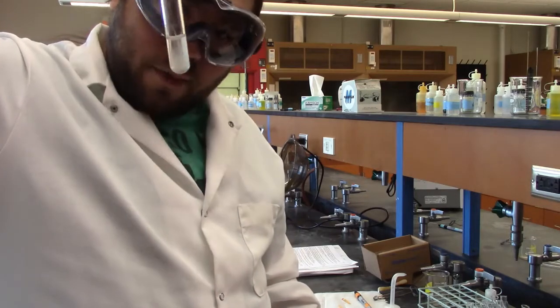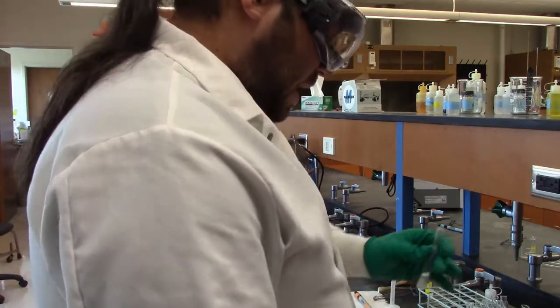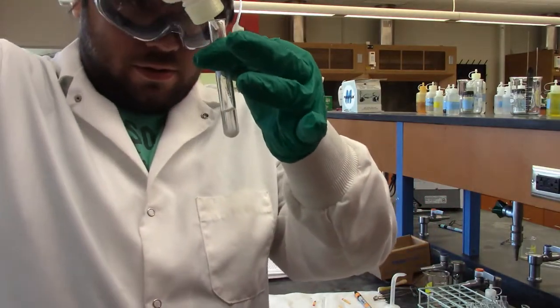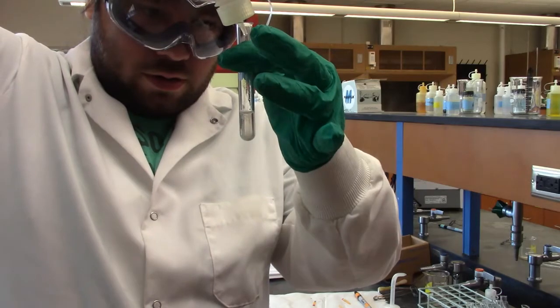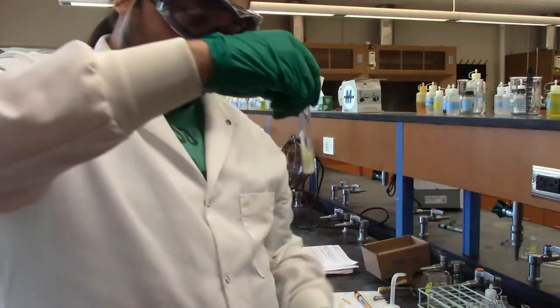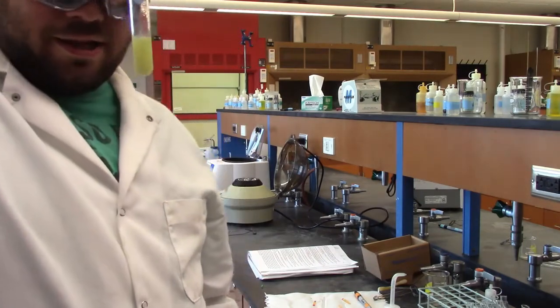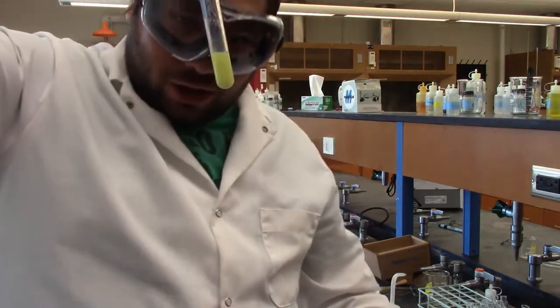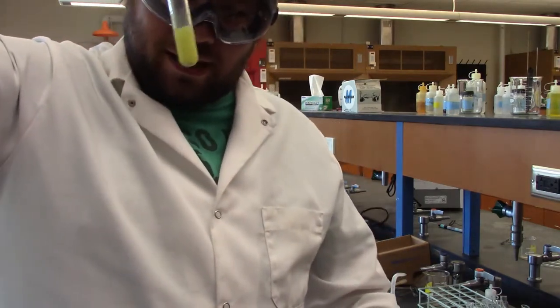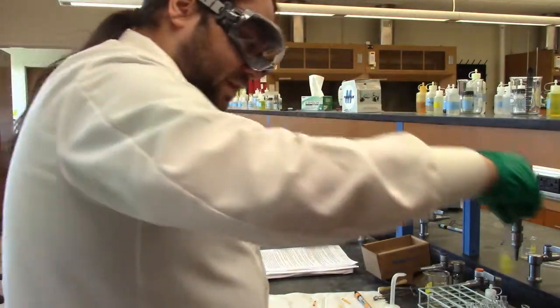So that's probably our cadmium, but we'll continue with the rest of the step anyway, where we add 2 drops of thioacetamide, just to get that extra sulfur in there. Give it a swirl. I don't think we need to heat that. The instructions technically say to heat it, but look at that. We got that bright yellow color going on there. We've got cadmium. And I'll just let that sit for a second.